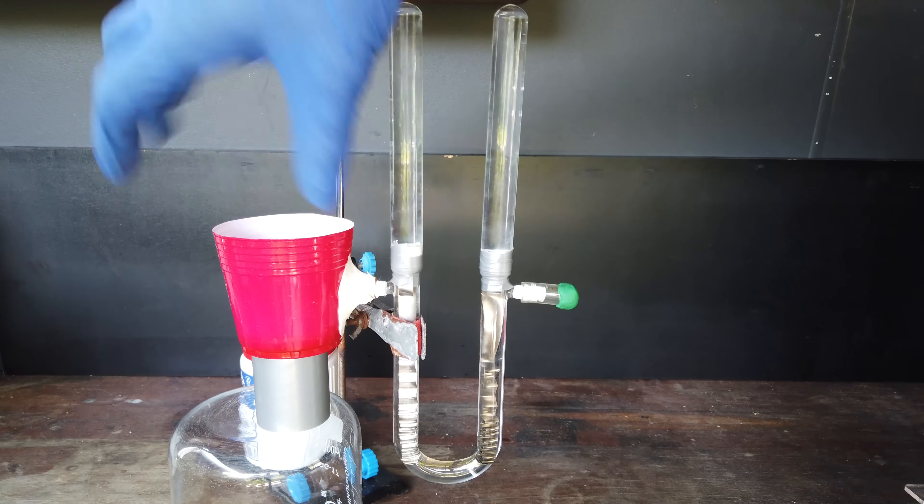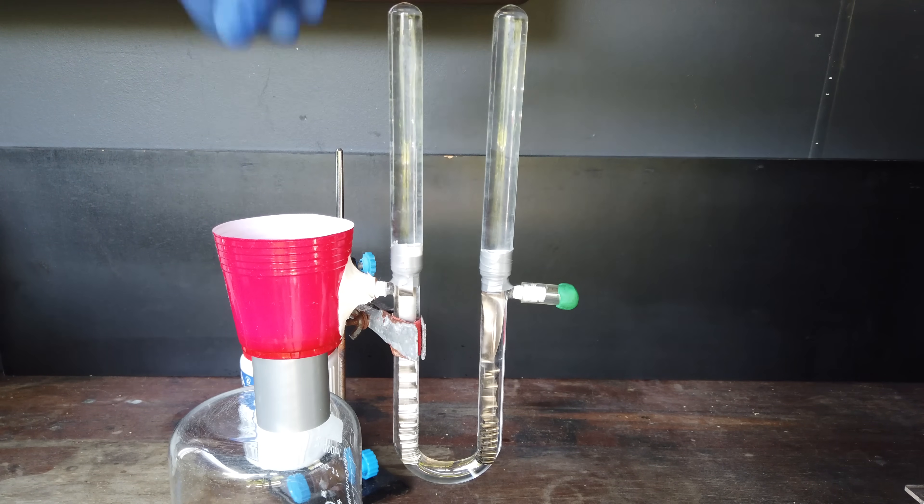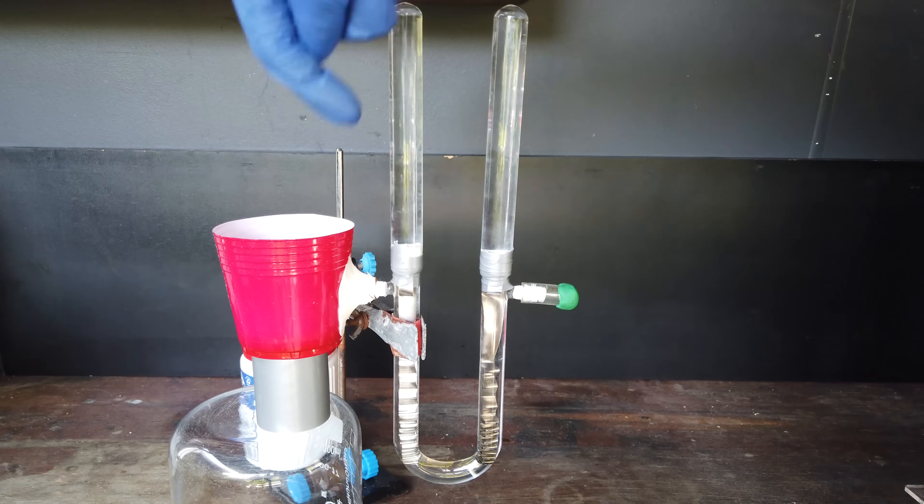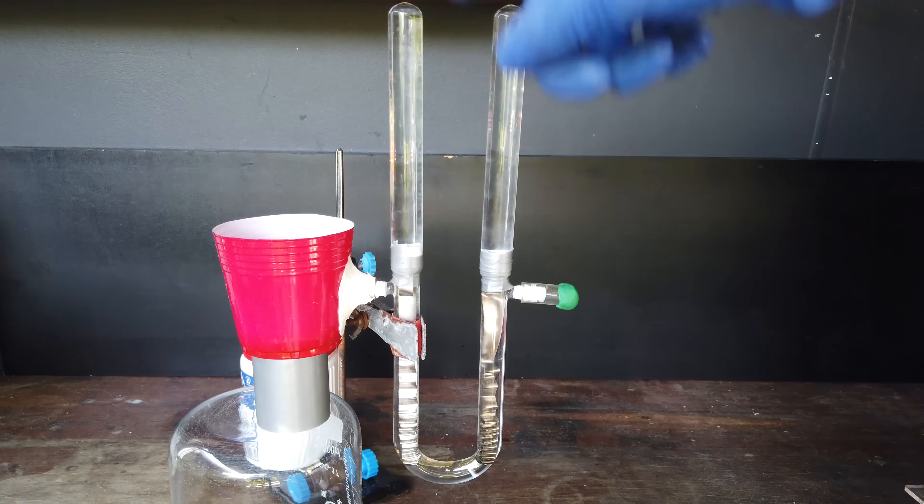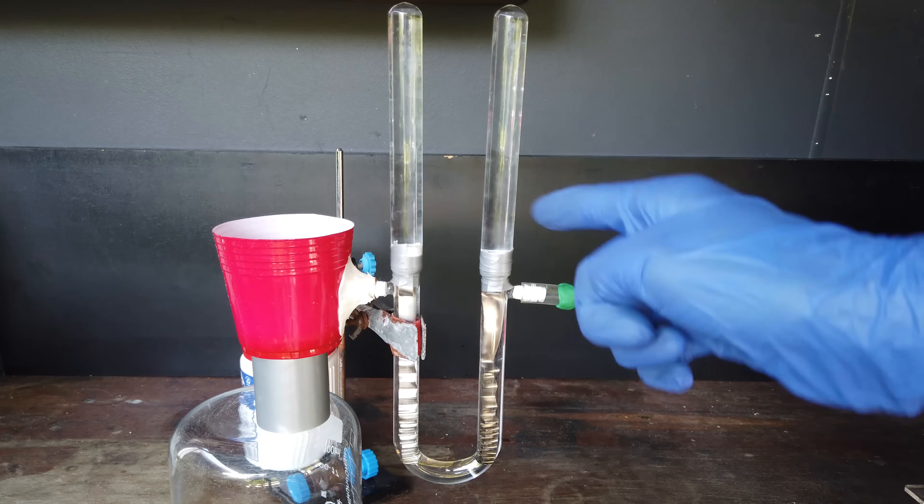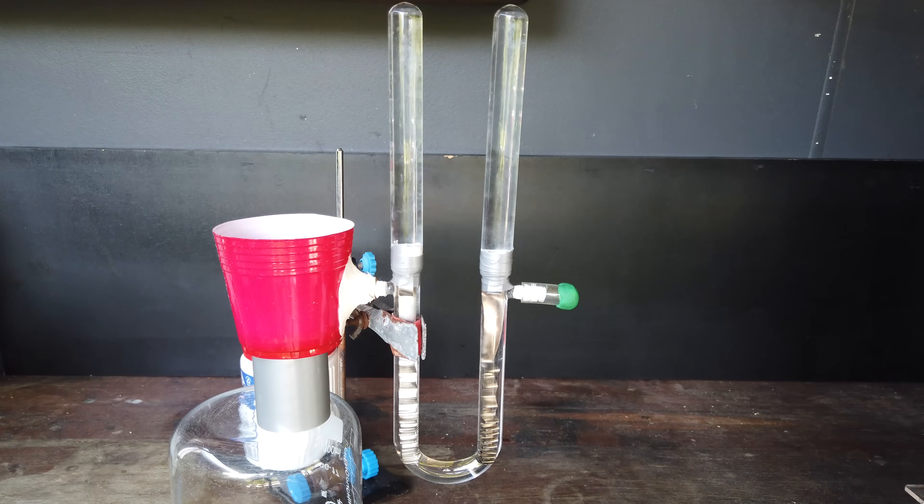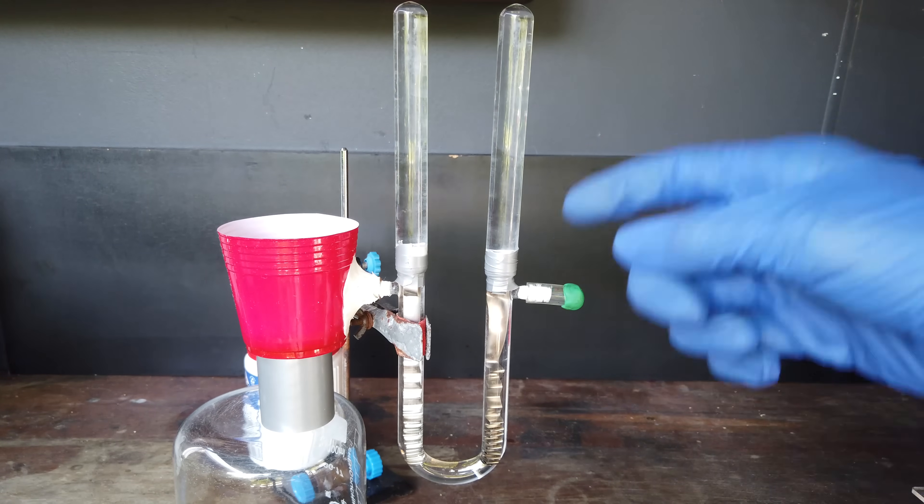We're connected to just a little reservoir of our solution so that the air from the atmosphere can't get in. But as we fill up these test tubes with gases, the solution will have somewhere to go. So I think this is a much better setup.